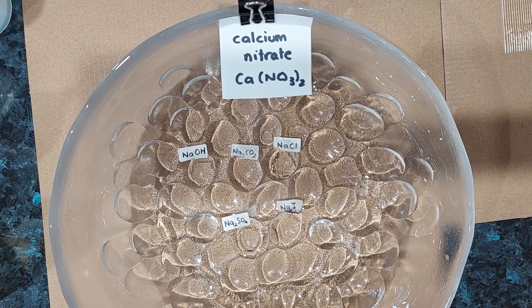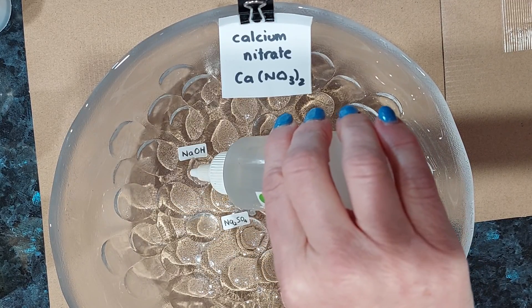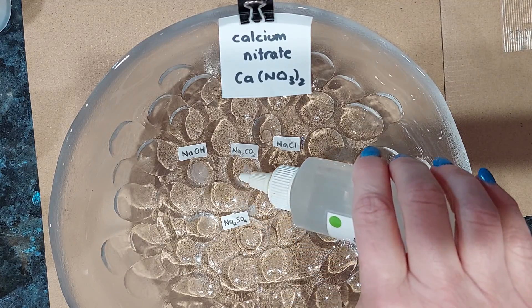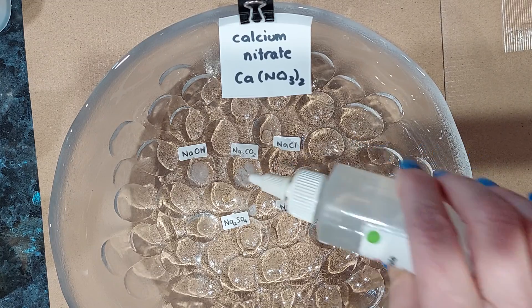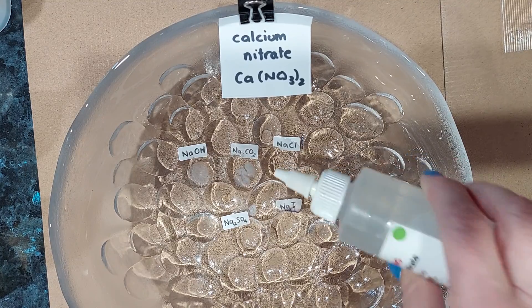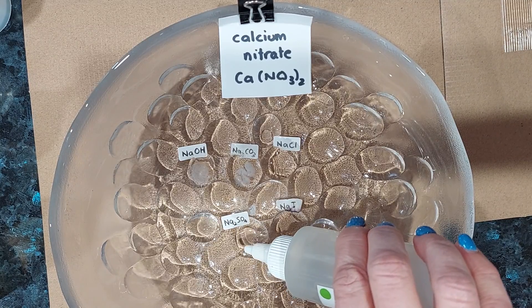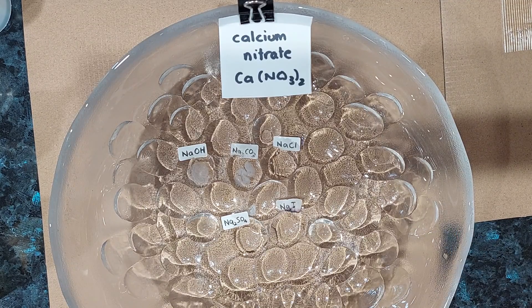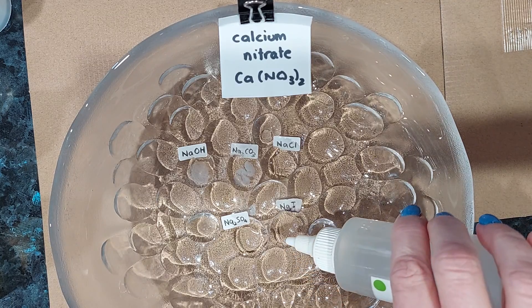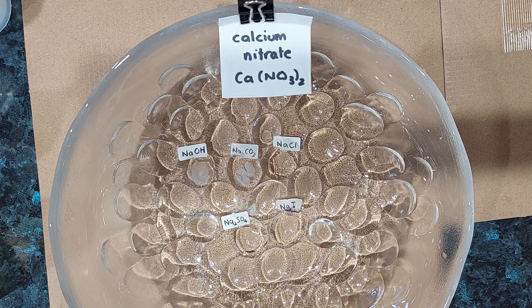Our last one — calcium nitrate. Calcium nitrate with sodium hydroxide — a fine white precipitate forming there. Sodium carbonate — again a white precipitate. Sodium chloride — nothing. Sodium sulfate — doesn't seem like much is happening there. And sodium iodide — again doesn't seem like much occurred there at all.